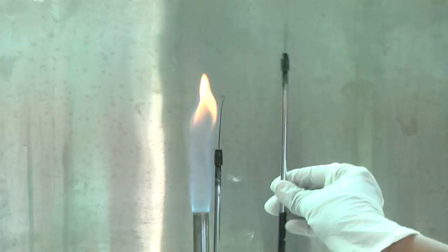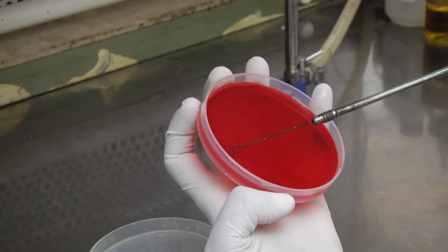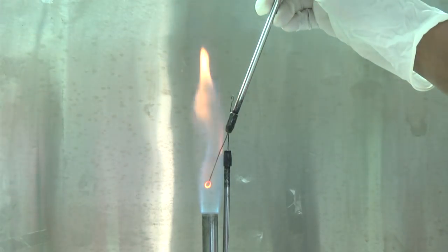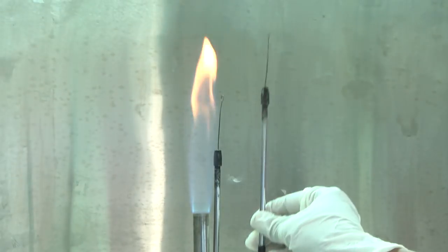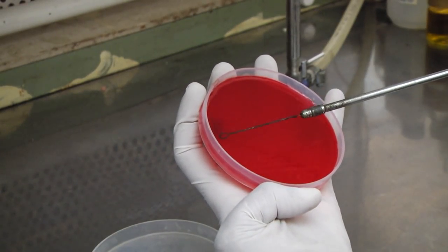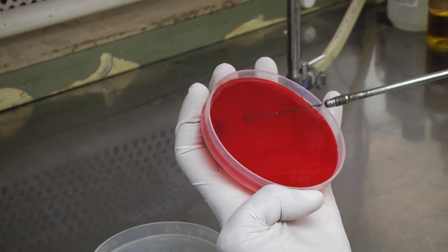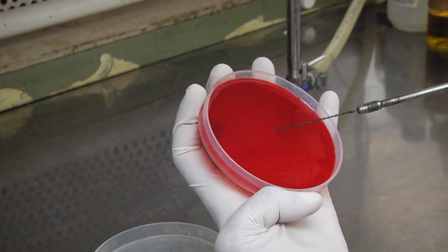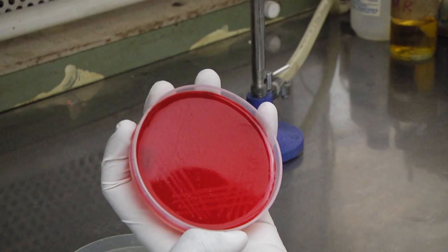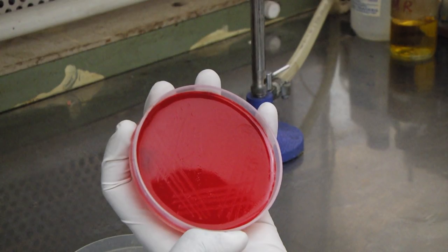Re-sterilize the loop and let it cool down. Use the loop to draw three or four parallel lines from the well inoculum onto the fresh surface of the medium. Again sterilize the loop and allow it to cool down. Repeat the process until the surface of the medium is adequately covered, taking care to sterilize the loop after each inoculation. At each step, the inoculum is derived from the most distal part of the immediately preceding strokes.